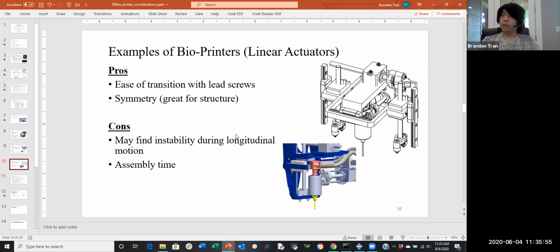The reason I designated that right now is because if you can basically see in this rotation right here, there's not much support holding it. So we have a big moment arm happening that's just dangling out in this area. If they had something like this, which is a wedge support to hold it horizontally, then it'd be less susceptible to possibly tipping over. But other than that, they did not include that. So there is some instability that might happen in that direction.